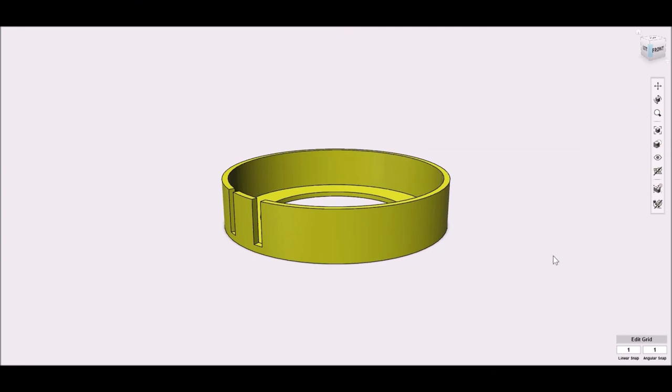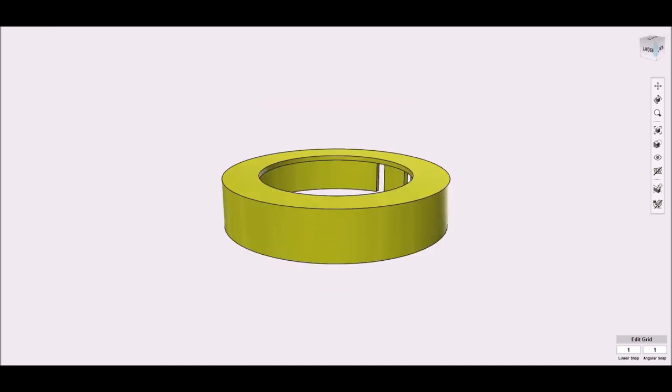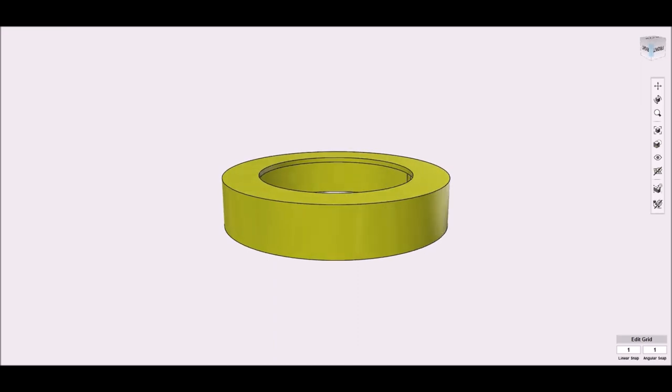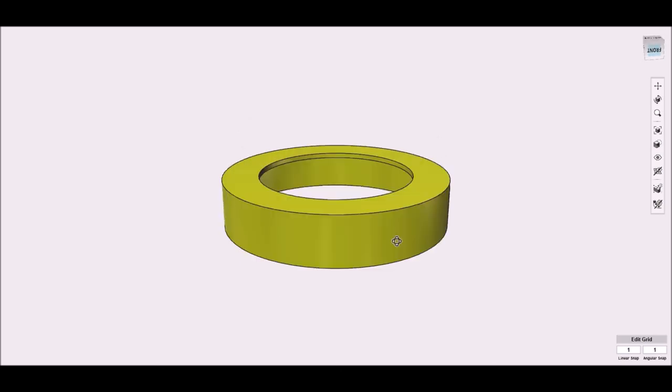The last 3D printed part is just the cover for the ring light. It has a couple of slots for the wires going to the ring light, but its main function is just to attenuate the stray light coming off the ring light. I kept the tolerances loose just so I could cover it with something really opaque, in case the attenuated stray light was still too annoying.